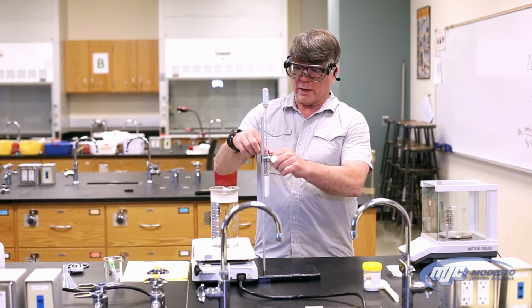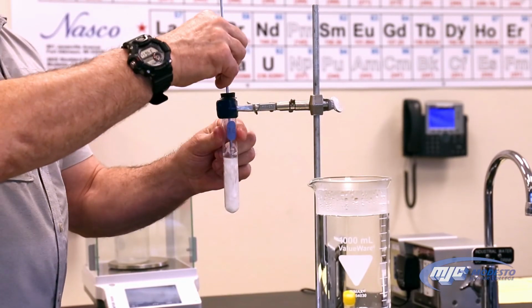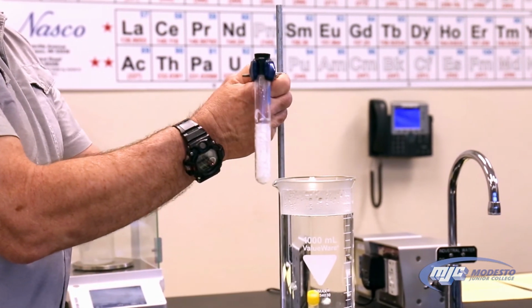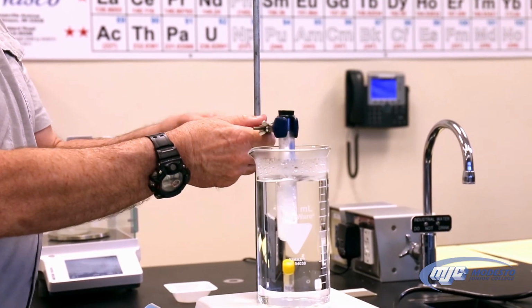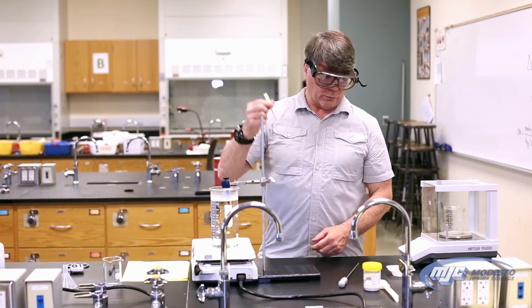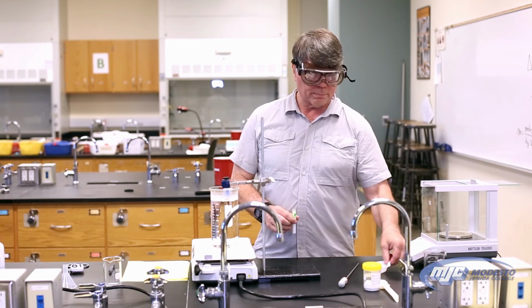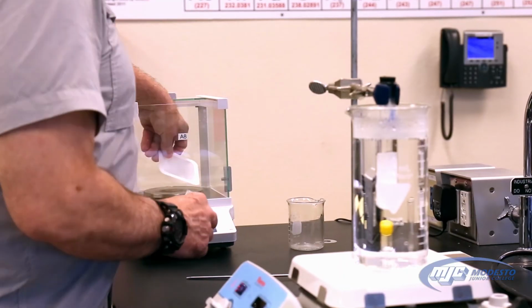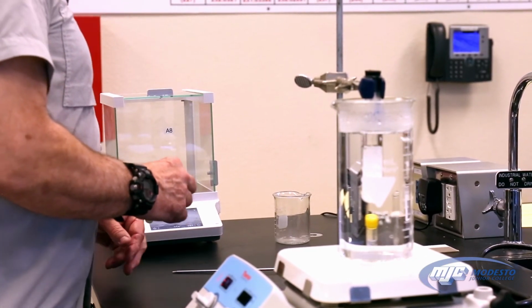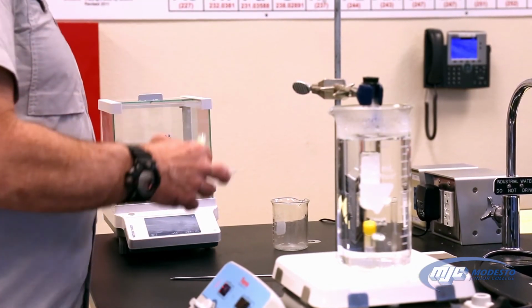So what we're going to do now is we need to melt this again. We're going to put it over here, and as we're waiting for it to melt again, we are going to weigh out our unknown. Our unknown is the solute. That's what it looks like. And so we're going to take a weigh boat right here and put it on the balance, tare it out, because we don't care what the weigh boat weighs. It says 0 with the weigh boat on it. Take it out. Take all of our unknown, dump it into the weigh boat.